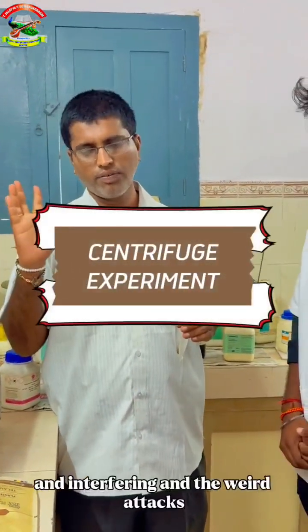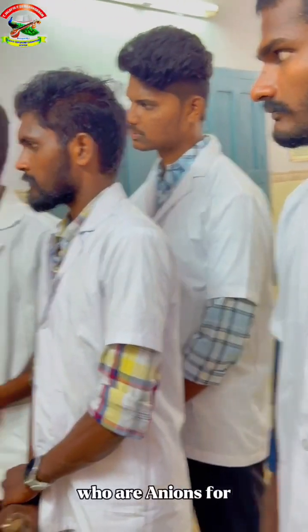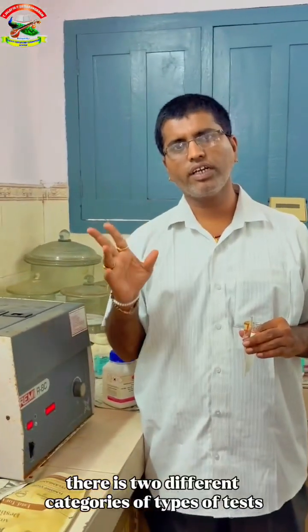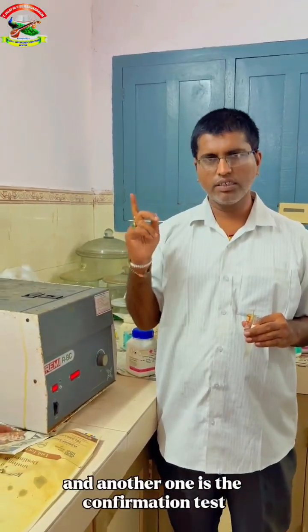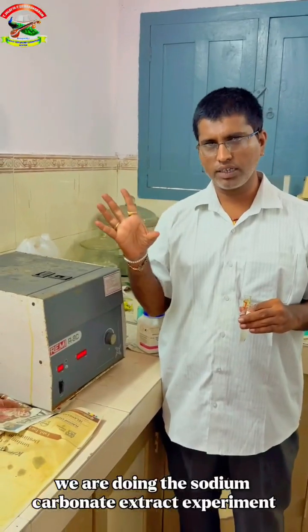Mixture mainly containing the anions and cations and interfering reactants. For identifying the cations or anions, for every ion there are two different categories of tests: one is the identification test and another one is the confirmation test. Under the confirmation test category, we are doing the sodium carbonate extract experiment.